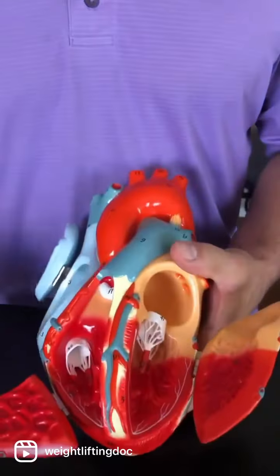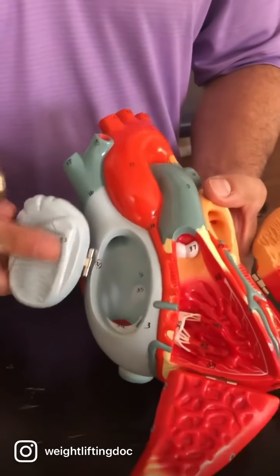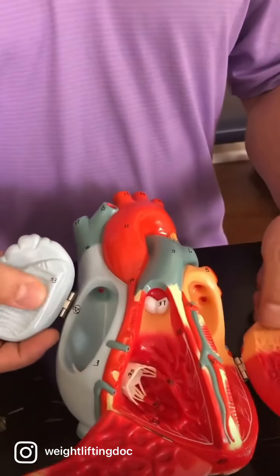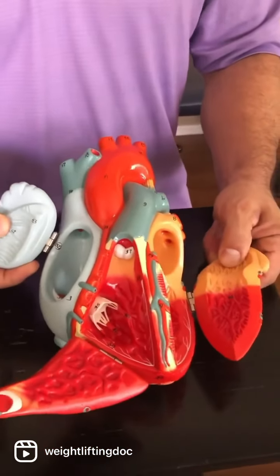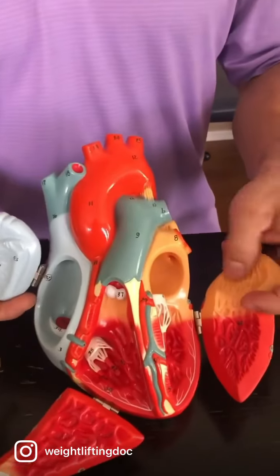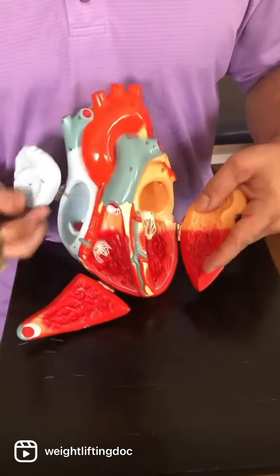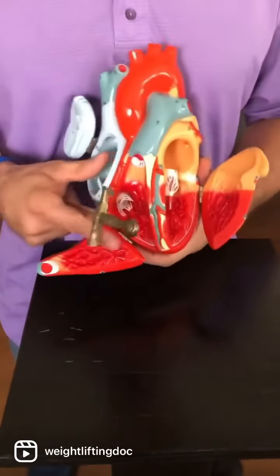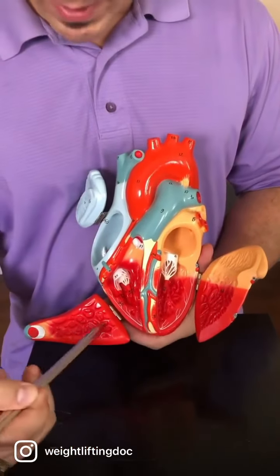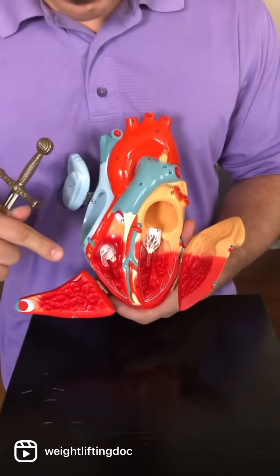Now you've got muscle that lines the atria and the auricles that we mentioned, and that muscle inside the atria is called pectinate muscle. So if you look on both sides here and here. If we go down into the ventricles, this stuff here looks like Freddy Krueger skin, right? That rough-looking stuff is called trabeculae carneae. It's in here as well. Think of it lining the whole cavity.